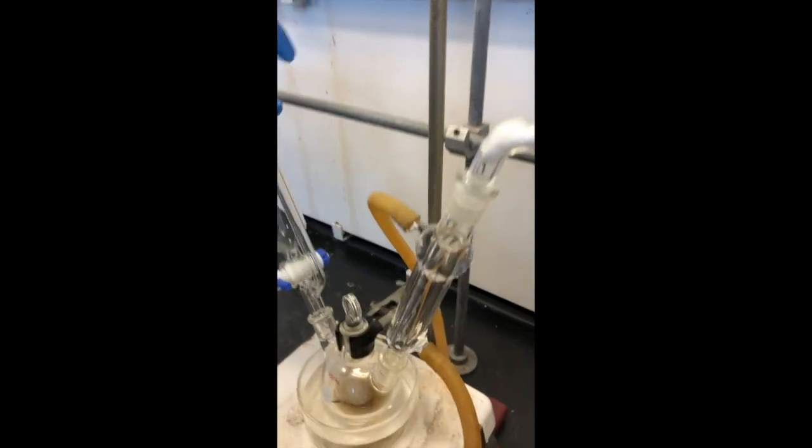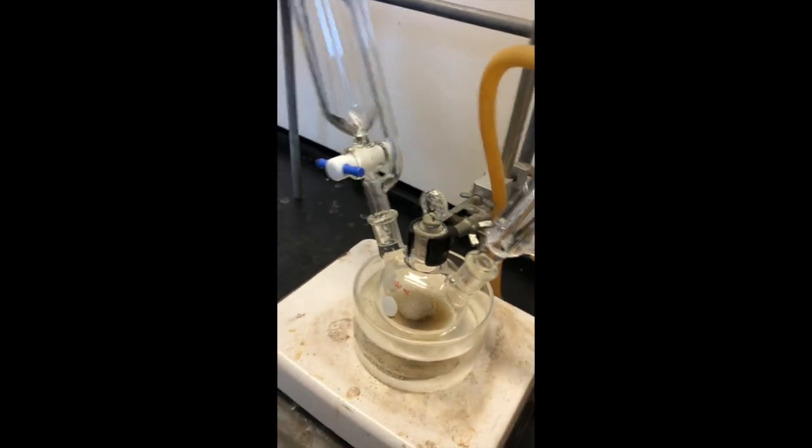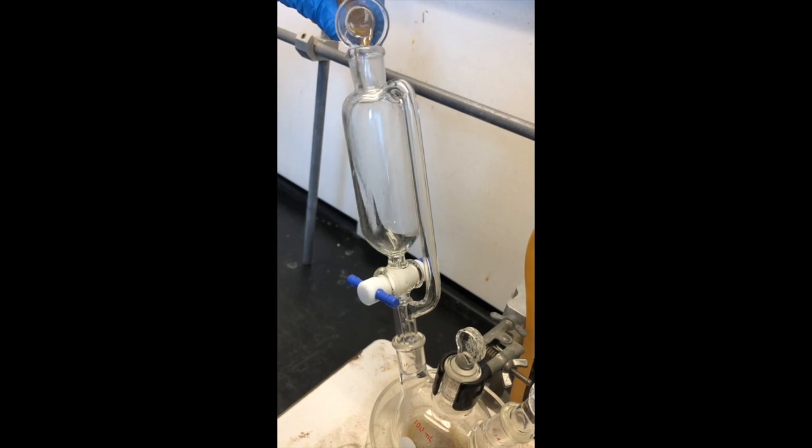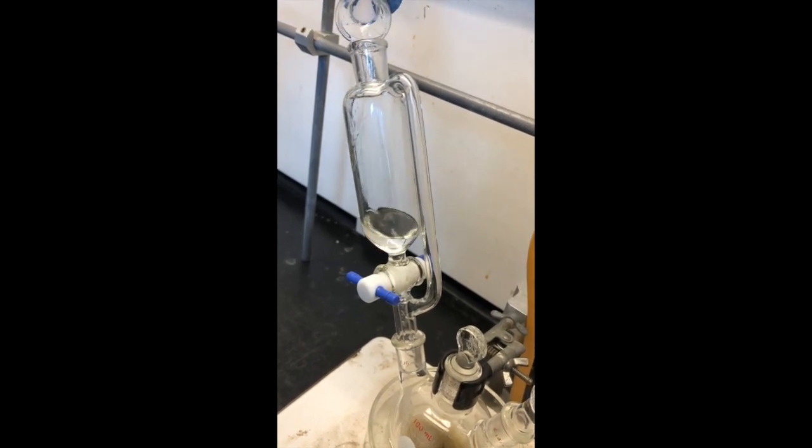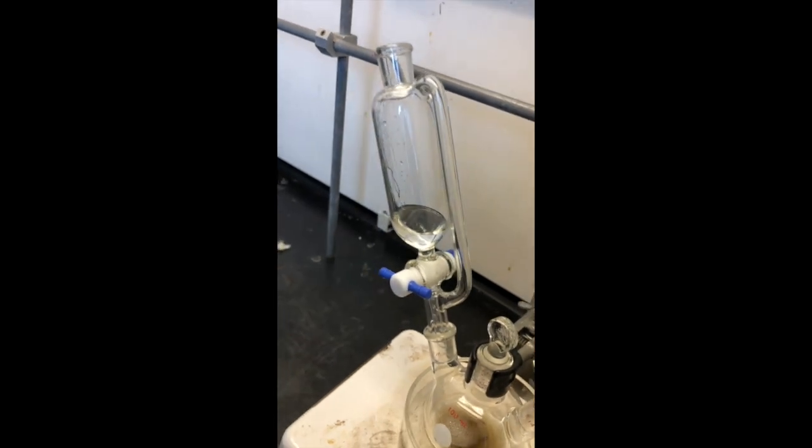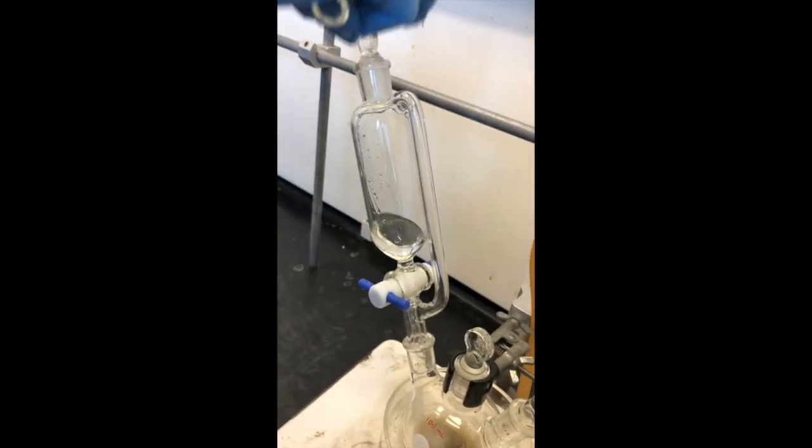So we're going to go ahead and add now, without stopping the boiling, without stopping the stirring, with the stopcock closed, add our acetophenone solution carefully into our addition funnel. Smells like cheap shoes. Yes. That sickly sweet smell of acetophenone. And again, the joy of this whole setup is that because we've got the addition funnel, we don't have to take the stopper off to add it.